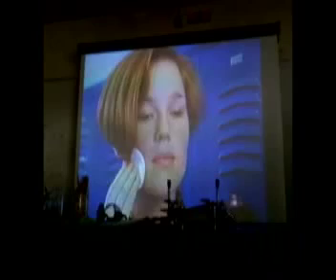Chemical spills and splashes are also common lab accidents. If a chemical hits your eyes, wash them immediately in an eye wash fountain. Hold your eyes open and roll them around so the water can wash them thoroughly. You shouldn't be wearing contacts, but if you are, get them out as soon as you've given your eyes a good initial rinsing. Continue washing for at least 15 minutes. Then see a doctor immediately to check your eyes for damage.